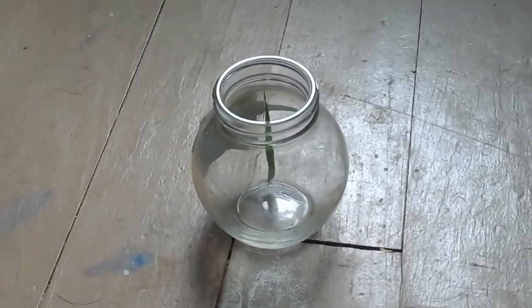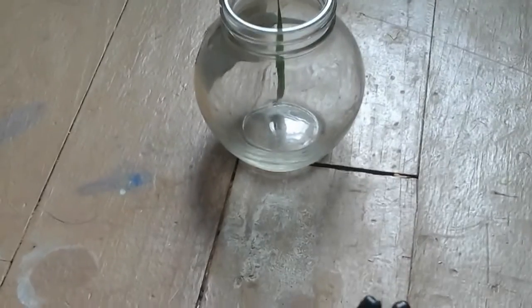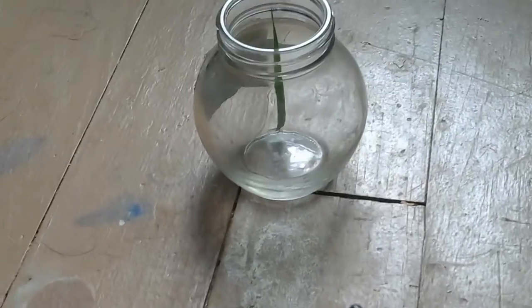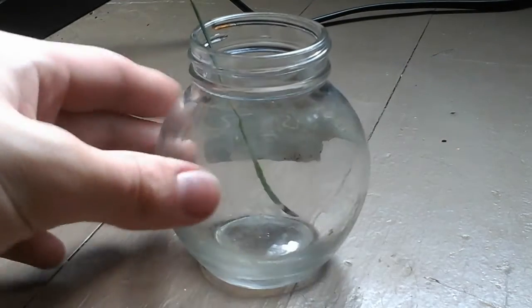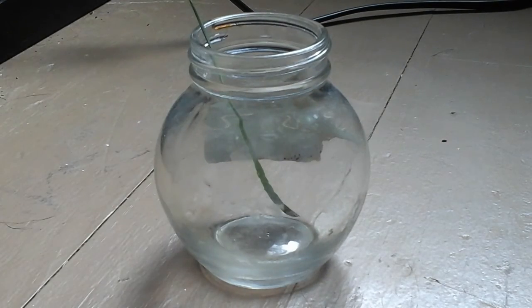And it's basically organic matter versus HCl. So I have a little blade of grass in there. I'm going to be adding the HCl now because I was wondering if I could use it to get rid of some pesky plants outside.